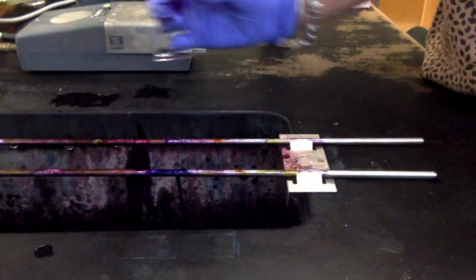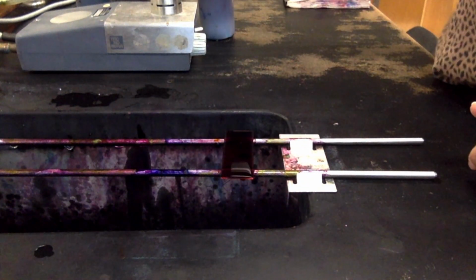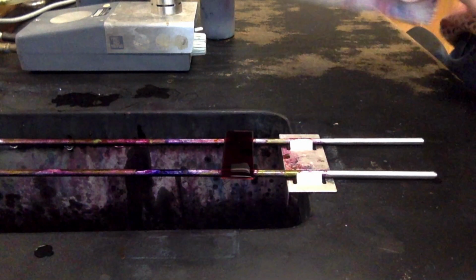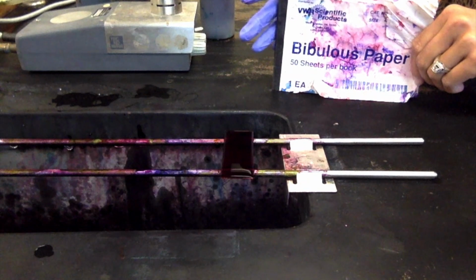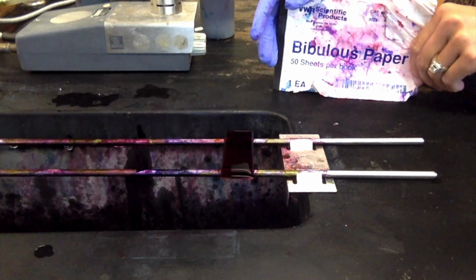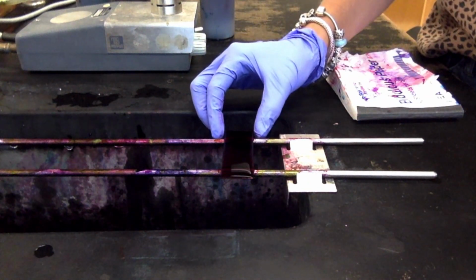It's just colorless. So now we are going to counterstain with our safranin, and that is going to stain our gram-negative cells. So again, you're going to let it sit for a minute. After the minute, we are going to rinse with water, and then we are going to blot with our bibulous paper, just like we did with our simple stain. And then we're going to look at it, and hopefully our gram-positive cells are purple, and then our gram-negative cells are pink/red. Your book says red, and a lot of places will say red, but I always say pink, because under the microscope it does look pink instead of a bright, bright red. So that's why I just use that term.